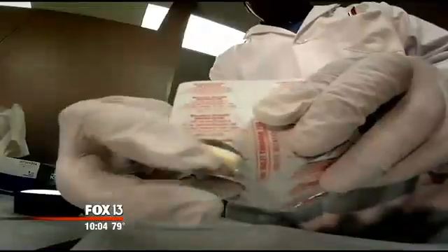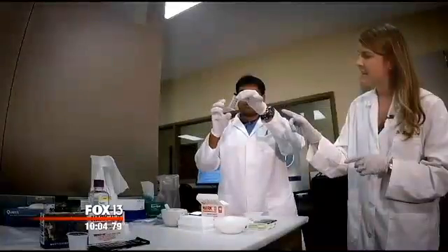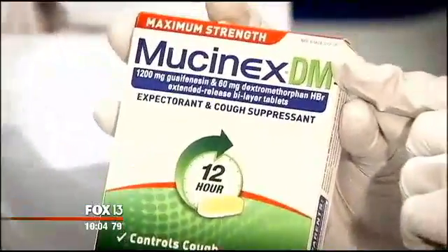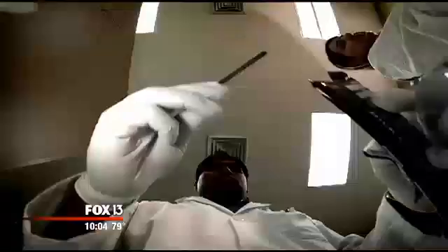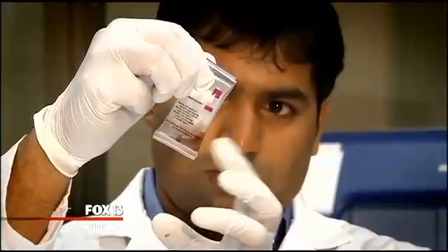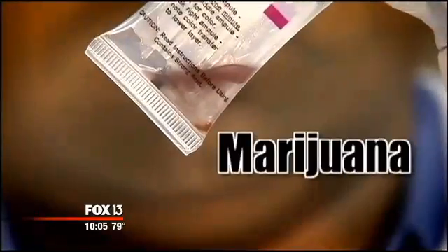They start with something you may have in your medicine cabinet. Mucinex. Watch as he breaks the first ampule and mixes the colors. You see the color reaction occur almost immediately. Dr. Hagen-Pay says the over-the-counter cough medicine in the NARC 2 kit tests positive for heroin and morphine in the sample. That's just the start. I'm sure we've all had one, a Hershey bar. After collecting some shavings, going to introduce a few small pieces of chocolate into the test kit. The color changes in both the NARC 2 and NIK kits. You'll see this pinkish purplish color develop. It takes just seconds, suggesting that this material may contain marijuana. Someone could be arrested based on this color change.